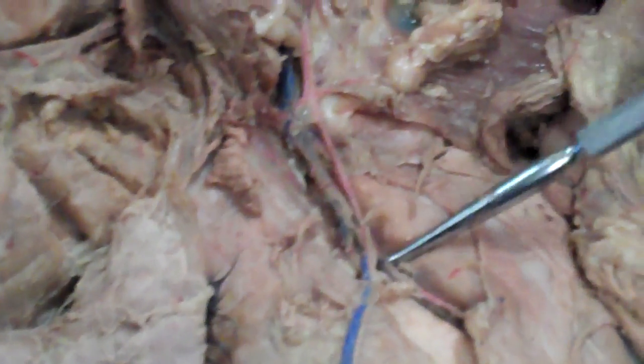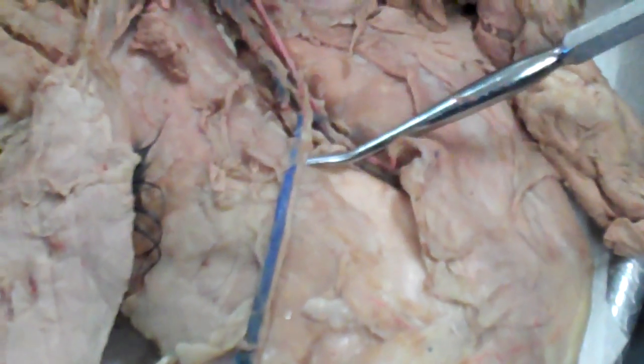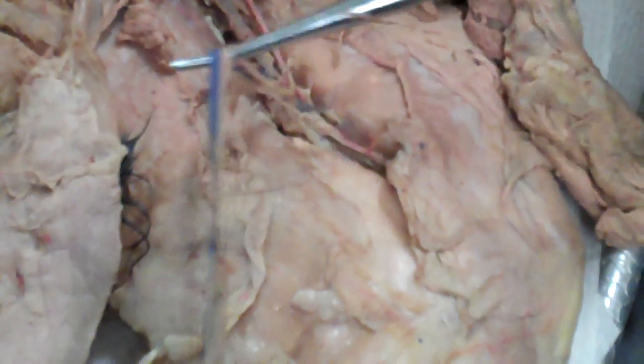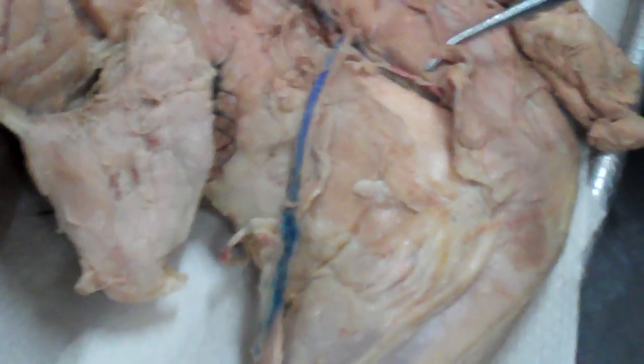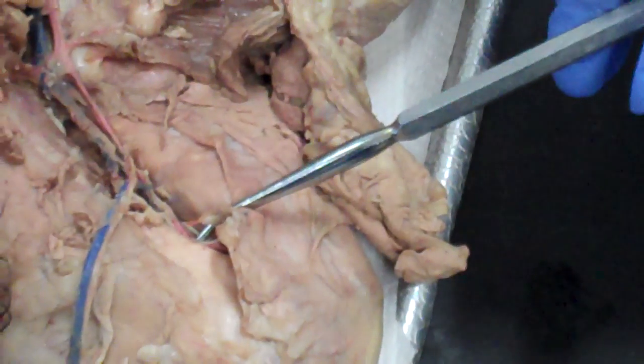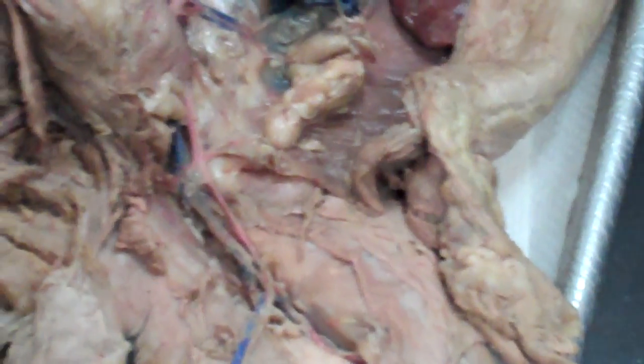That femoral artery then is going to branch into two. It's actually going to branch into the one that goes behind the knee, which is going to be the popliteal, and the one that's going to continue downward here, okay, which is the saphenous artery, okay? So those are all of the arteries that you need to be able to identify.